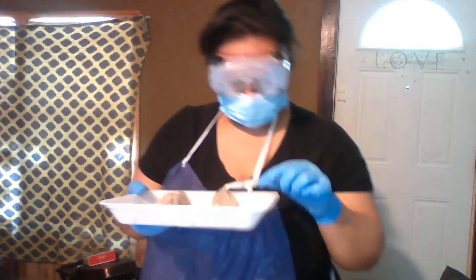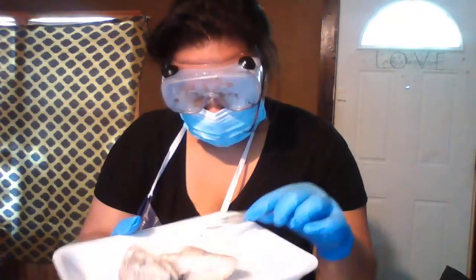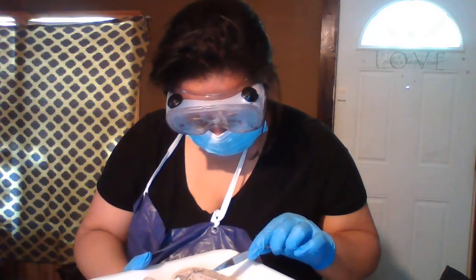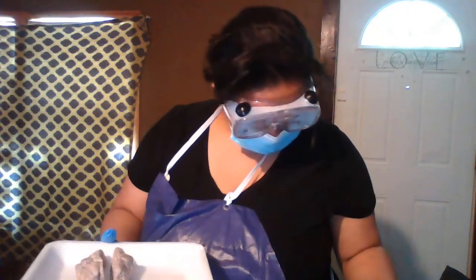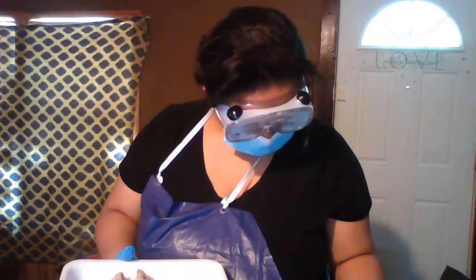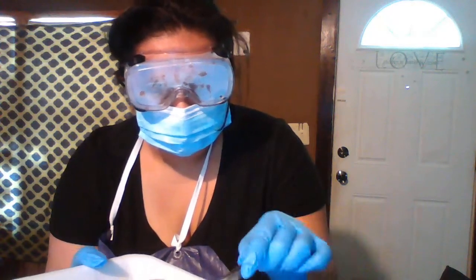Let me find it. I'm not used to this. It doesn't look exactly like what I thought it would look like.